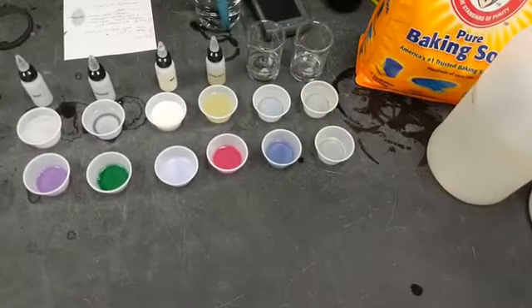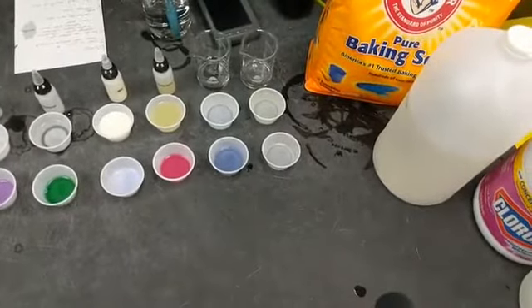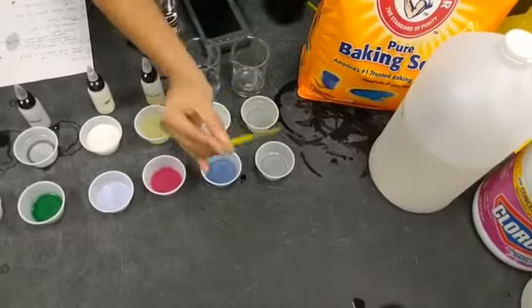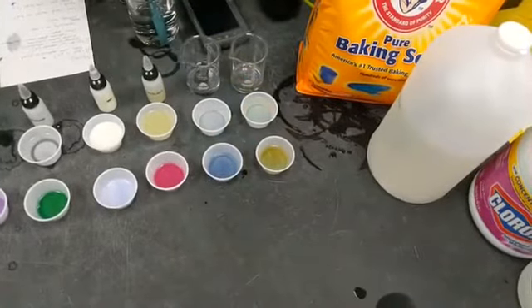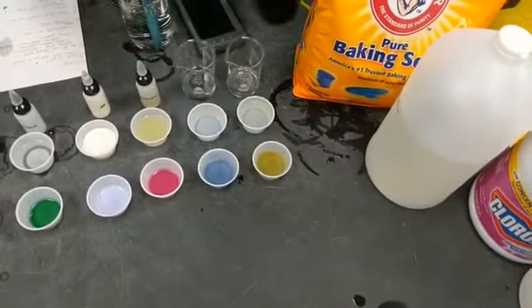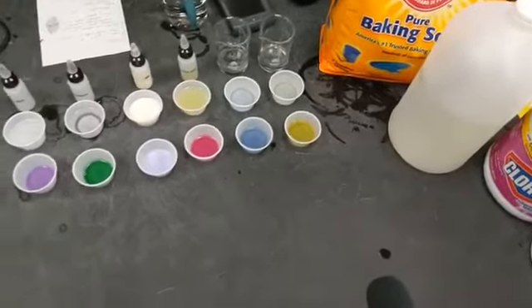Purple, kind of bluish, maybe a little bit of a weak base there. And then our last one is bleach. Again, mostly used for cleaning. That is quite a yellowish color. You can see it sort of starts out as green. Right, so that is also a base.